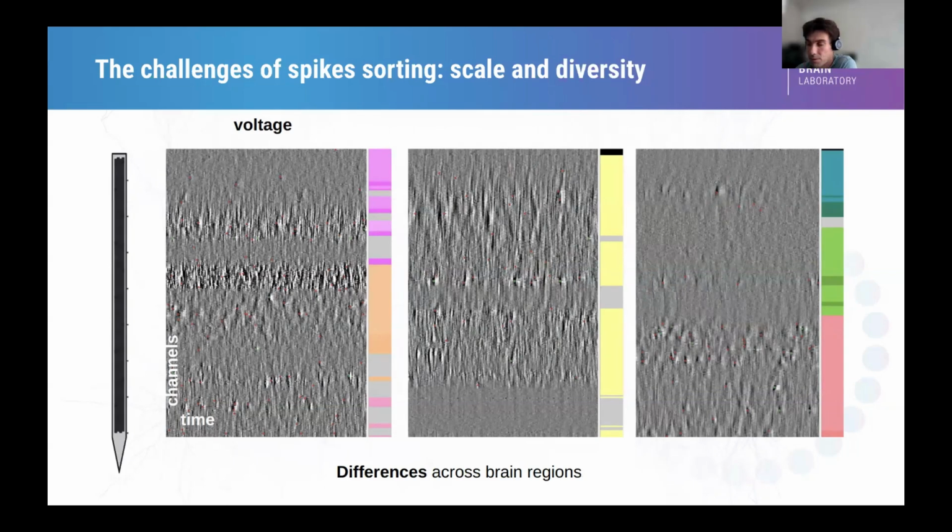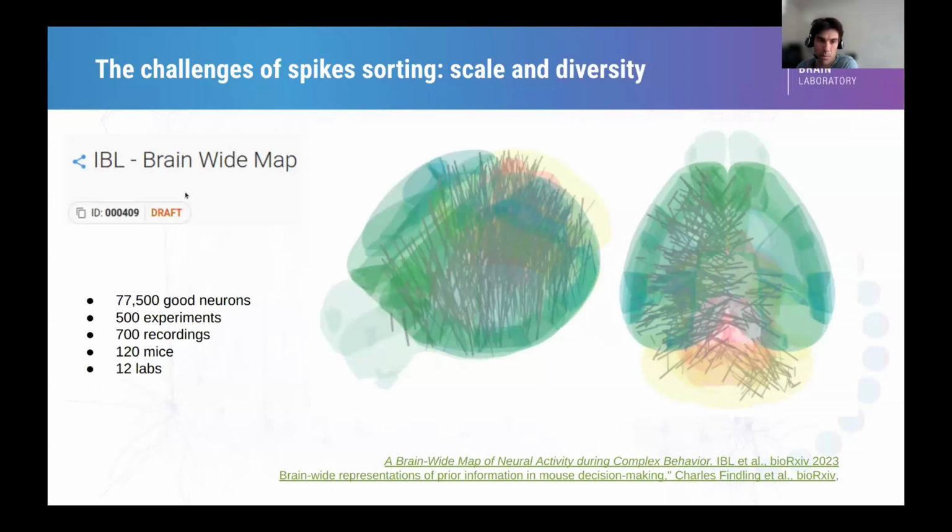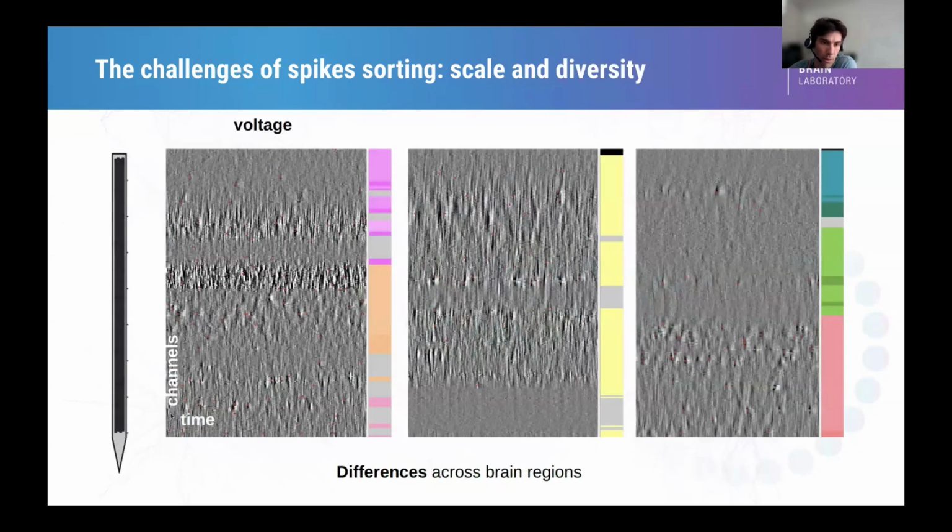So here we get 3 different displays. And you need to get used to those displays because I'm going to show them throughout the talk. So these are the channels on the y-axis. These are the 384 channels of the NP1 probe. And this is time. Here we are looking at more or less 50 milliseconds of data.